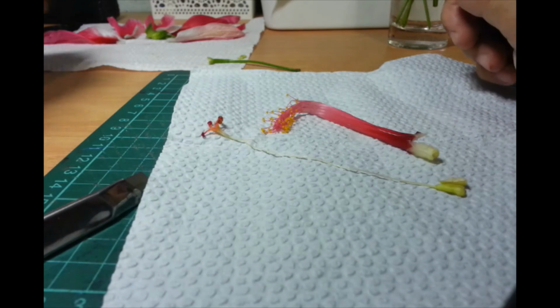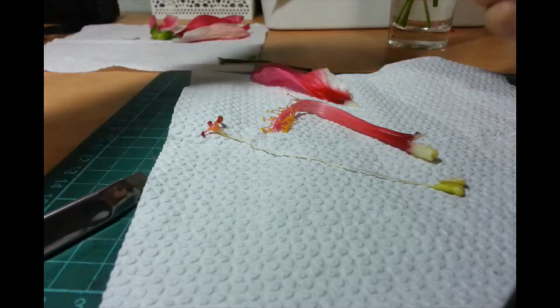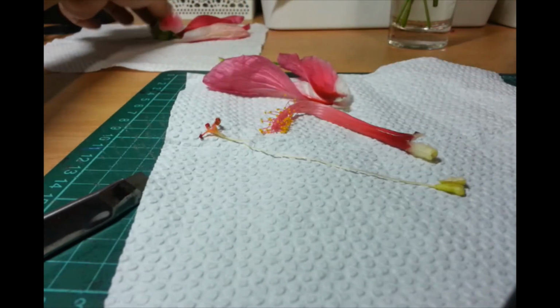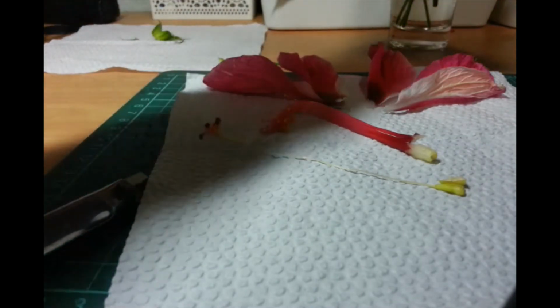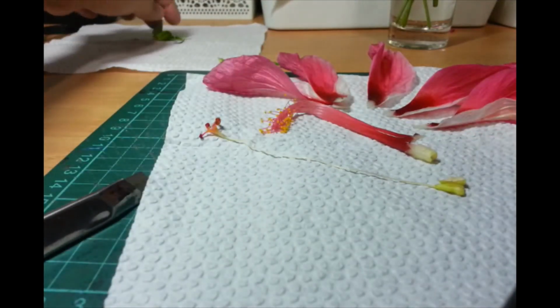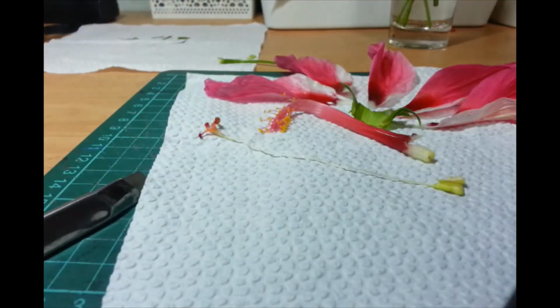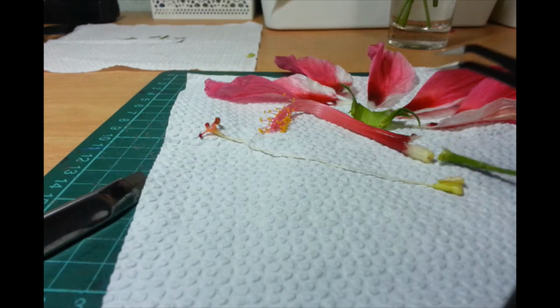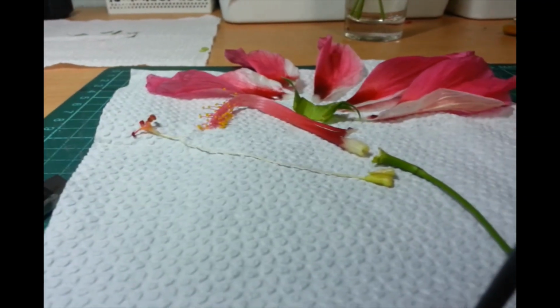Okay. And then, of course, outside it, we have accessory parts. So, yung mga decorative parts, hindi naman decorative na walang function, pero ang function niya actually is to attract the pollinator. So, we have the petals. Okay. And then, when this flower was still a bud, you had the sepals to protect it. Okay. And then, you have also the bracts, hindi ko nakunan. So, ito yung stalk na nag-attach ng flower sa rest of the plant with the receptacle, that fleshy part on top. Okay. And then the stalk that attaches it to the rest of the plant is called the pedicel.